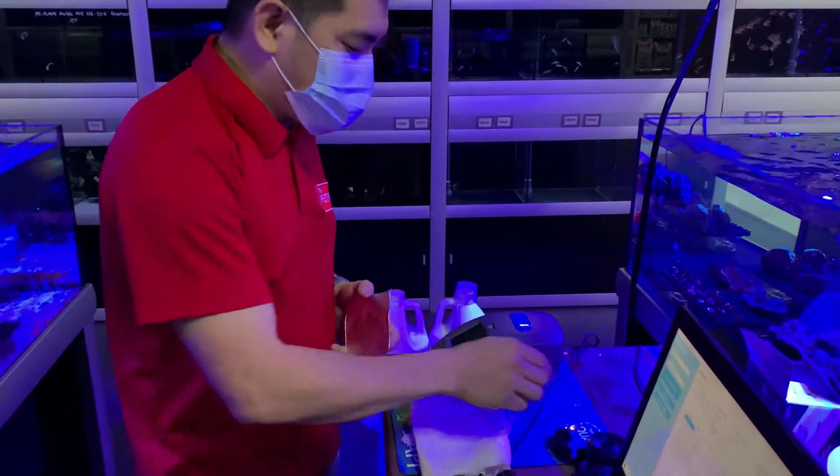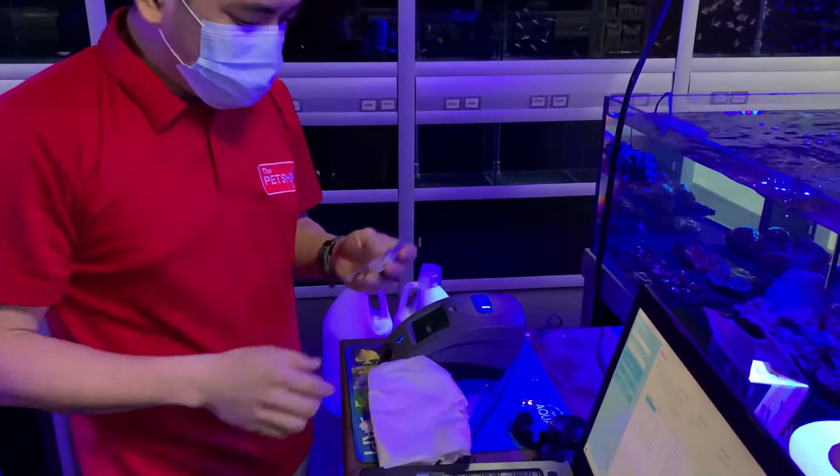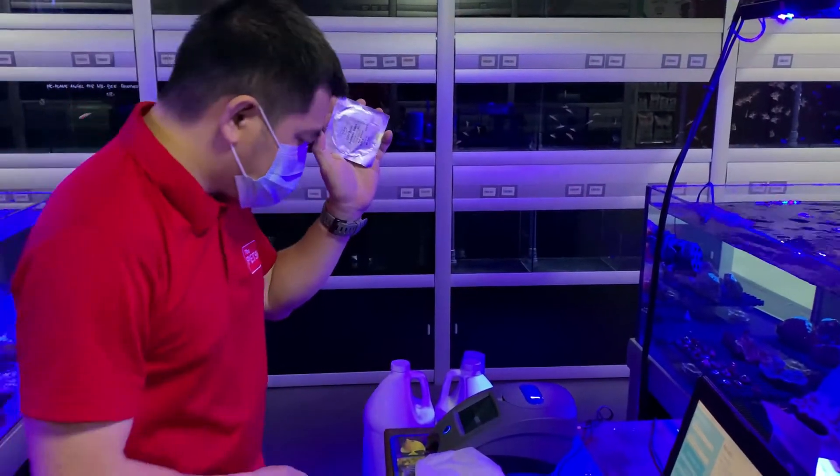First, we are going to get a water sample like what we did here. Then, this is the disk. So let's open this.